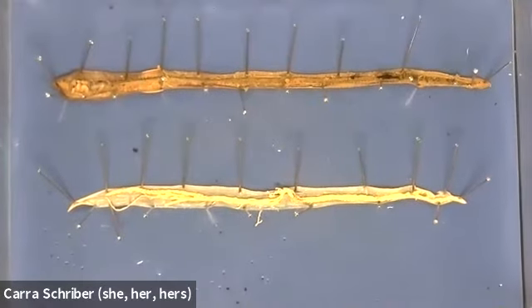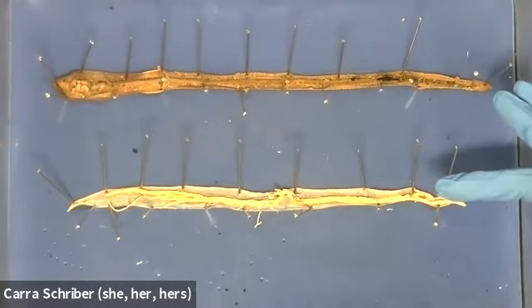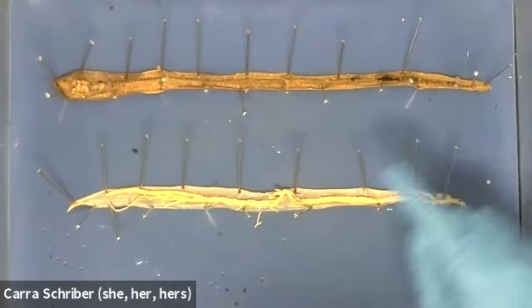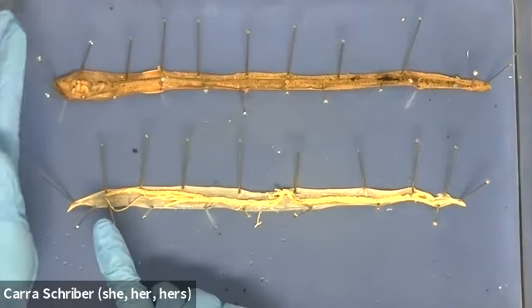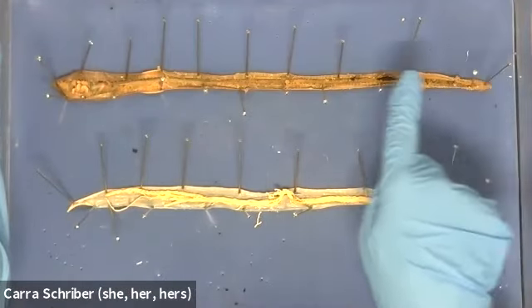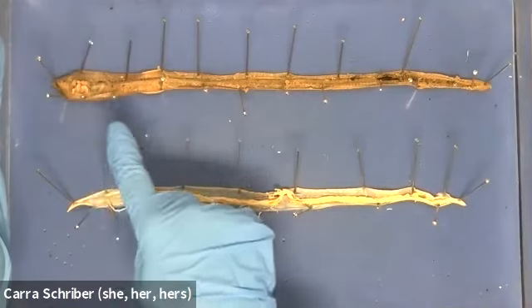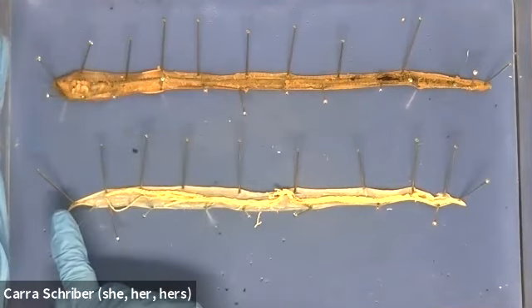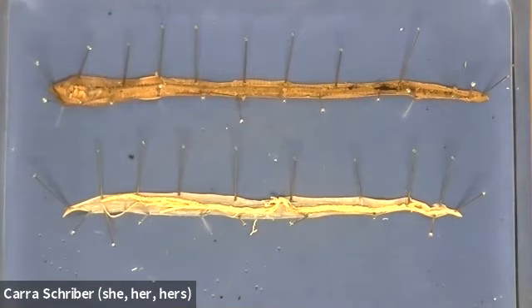So I hope this helped you to see the difference between a coelomate body plan and a pseudocoelomate body plan, the difference that makes on organ development and organ complexity, and then also the difference between, well, they both have a complete digestive system, but the difference between a digestive system that is mainly just an intestine and a digestive system that has a little bit more complexity, and also a little bit, I would say, more cephalization, right? So it was easier for me to find the head region on this earthworm than it was on the roundworm. So a couple of different things that we can consider in our dissection comparison here.